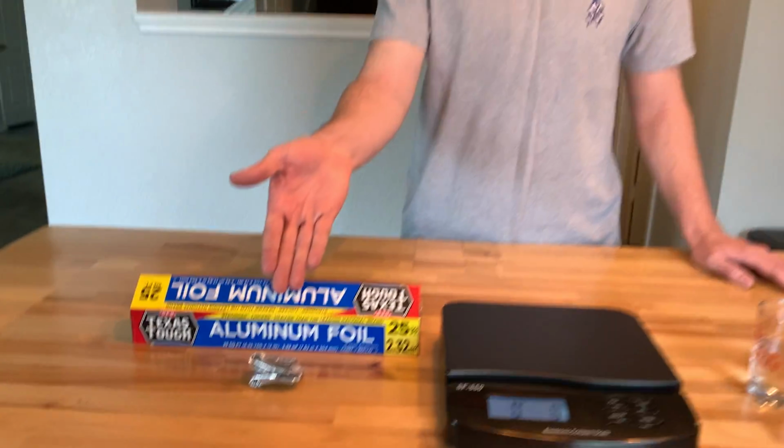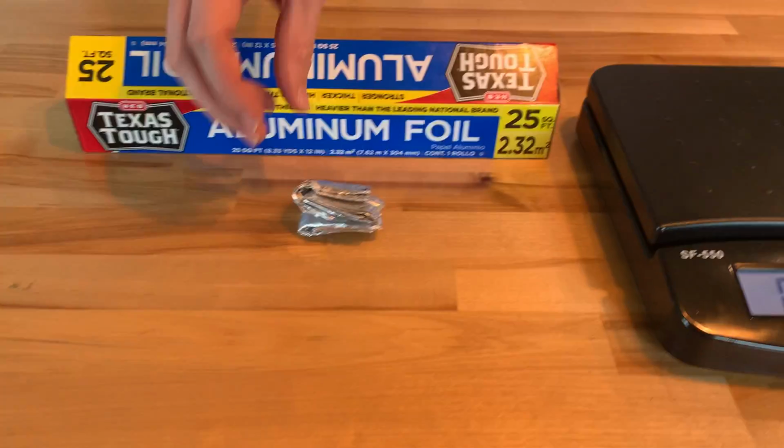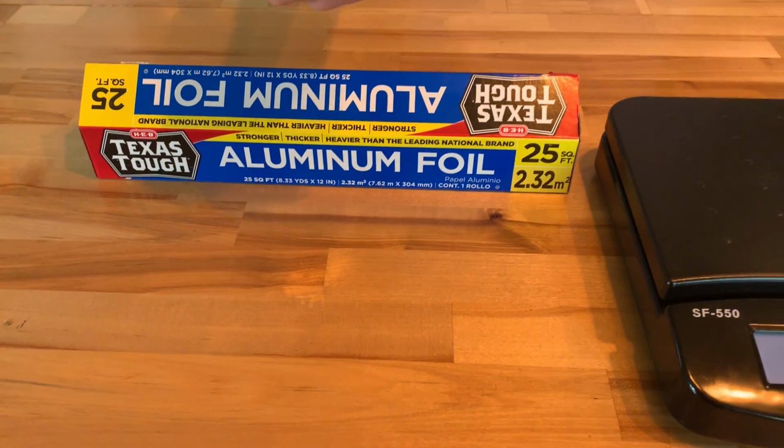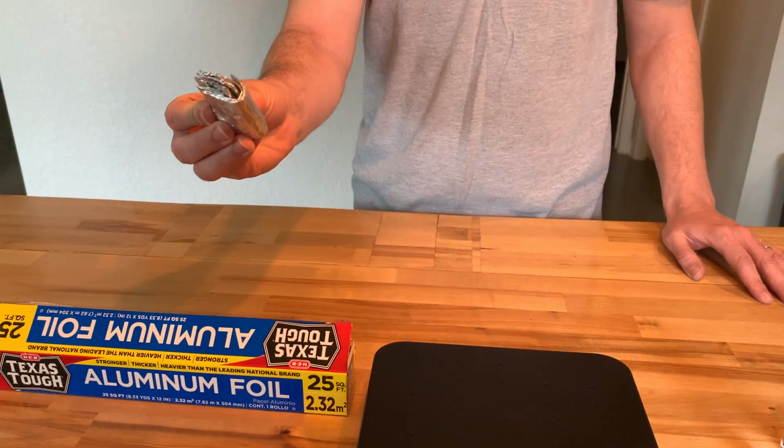But in this example, I have an irregular object right here. And what I'm going to do to figure out the volume of it is I'm going to put in a cup of water, and then I'm going to figure out what the difference of the final volume with the initial volume with the aluminum object added into it. So, as you can see, I have an aluminum foil right here, and this is going to be the object that I'm going to be using. It's very irregular, so there's no way I'm going to measure the dimensions of this object with just a ruler.